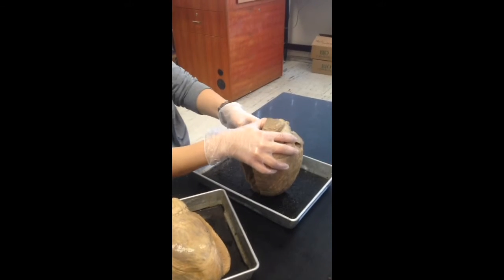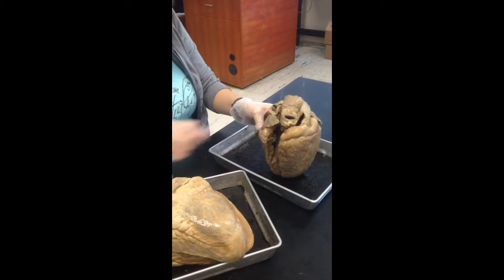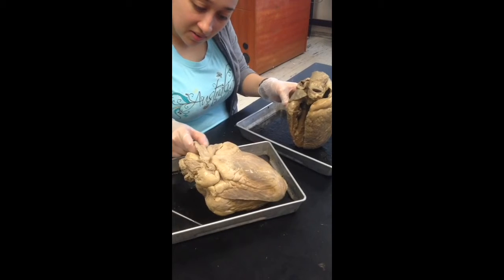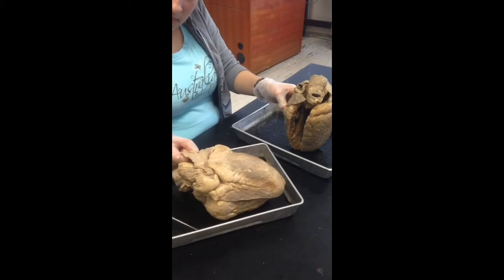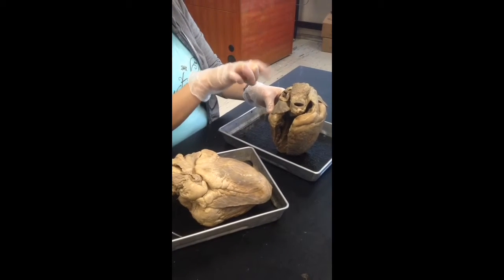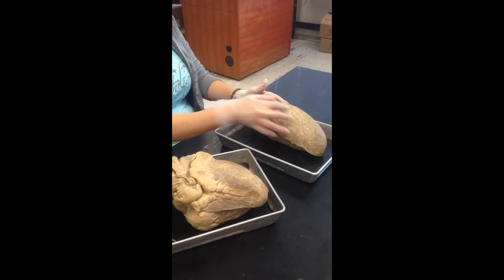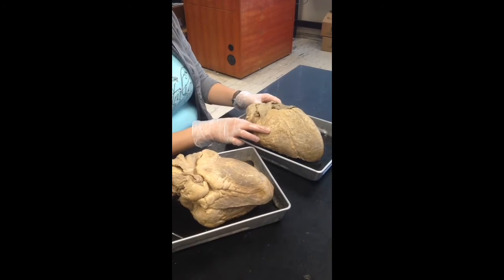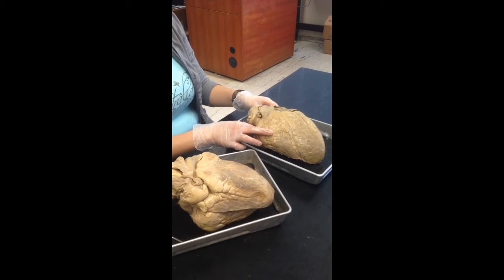Feel it here. I've never actually seen the coronary sinus, but it's definitely within. Like I can feel it here. It feels like, like I said, a little belly button. But I don't think you'll have to identify that. You can ask your TA to be sure, but I've never pinned it. I just asked for the function on the test, and like I said, it brings blood from the heart and dumps it into the right atrium.